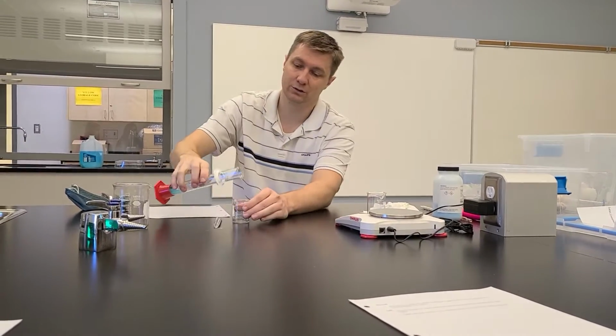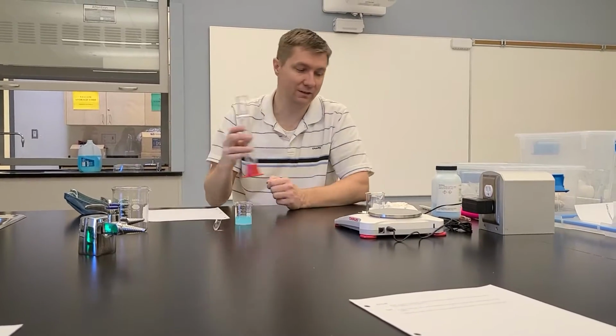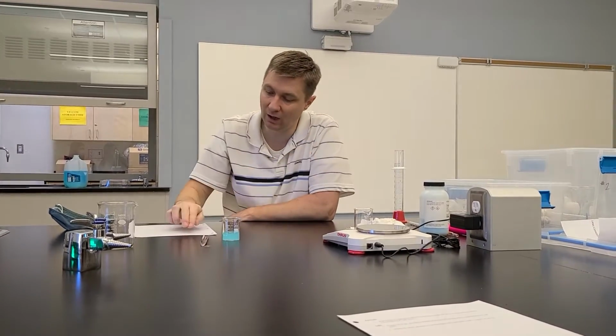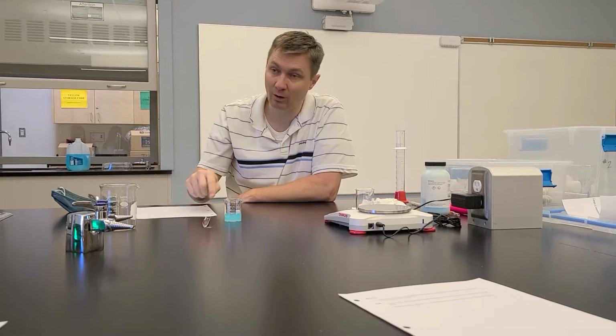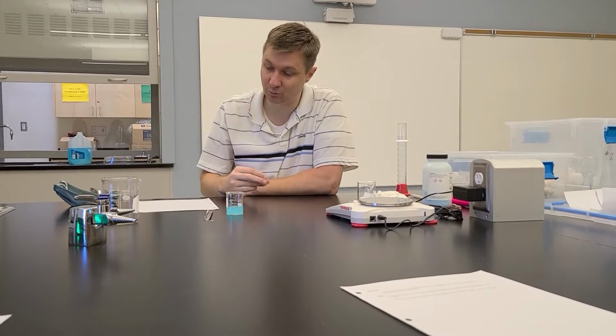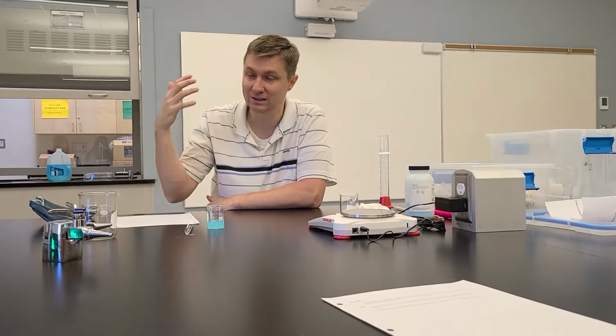Then you can pour your stock solution back into here, okay? Now, that is not the dilution. That is the preparation of the stock solution, right? So I've done what is in the pre-lab here, as well as lab number 1, step number 1, which is prepare the stock solution with that volume, 20 mils, and the concentration of 1 mole per liter. So that part's done.